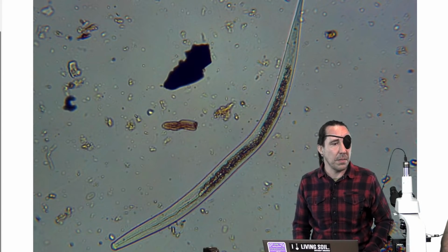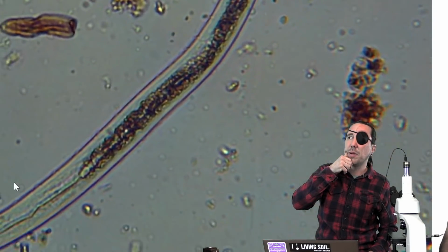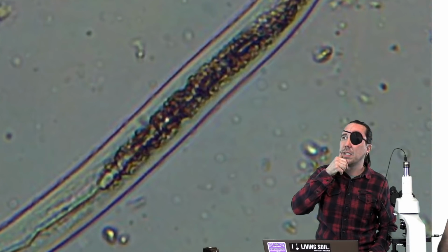Can you zoom in at all? On the camera, it's like not on its head part. Can you get to the head part? There you go. Let's see.